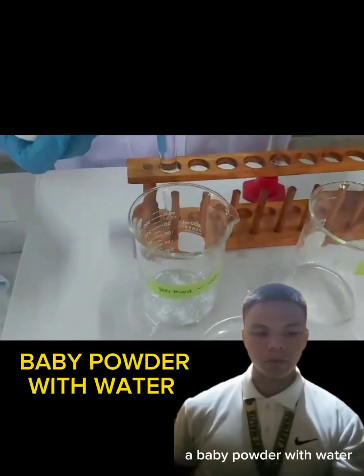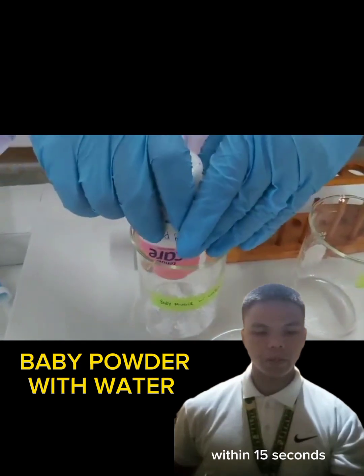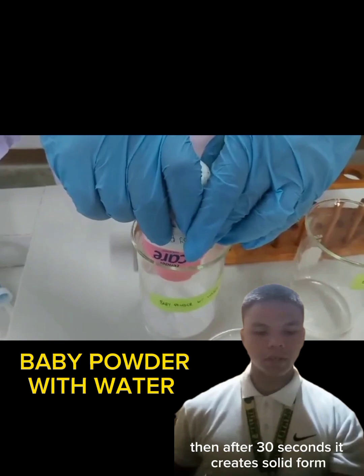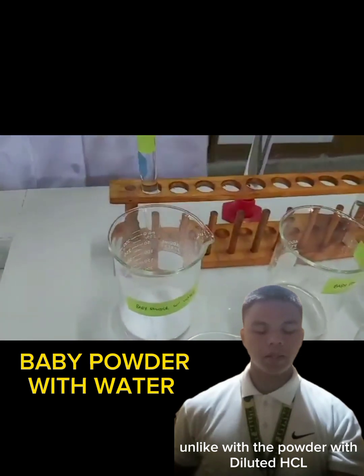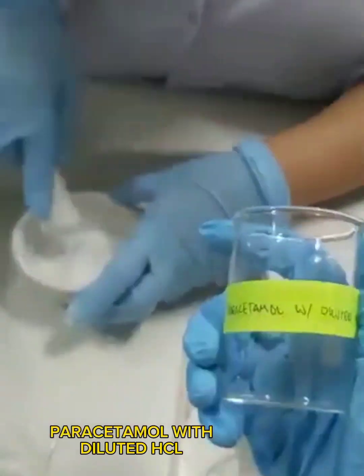Baby powder with water. We put 5 drops of water in the baby powder. Within 15 seconds, we observed that it is still not dissolved. Then after 30 seconds, it creates a solid form. Unlike the powder with diluted HCl, the water with baby powder has larger bubbles.